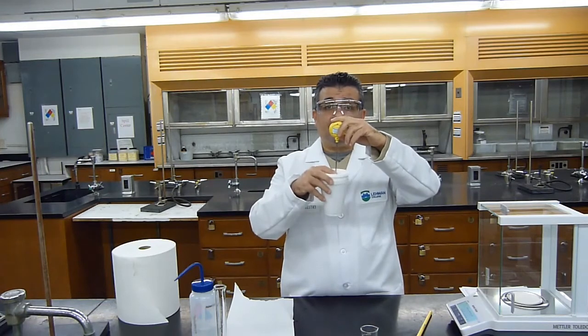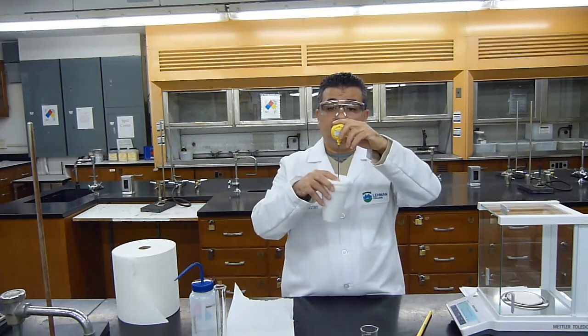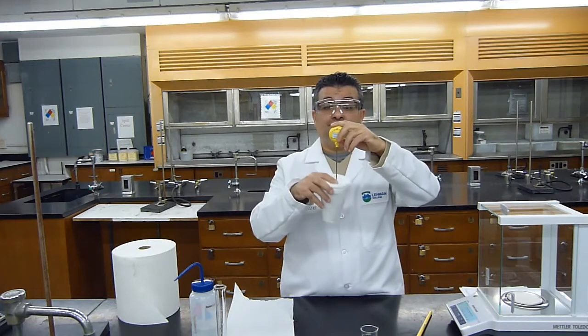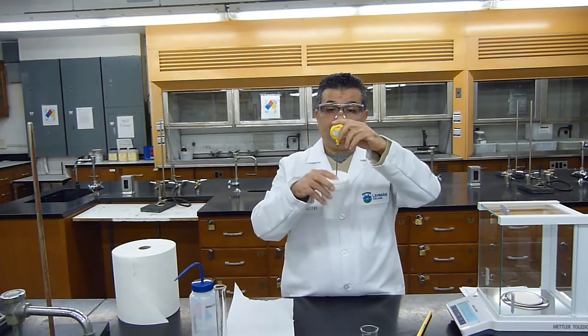I'm going to continue mixing and monitor the temperature. Now the temperature increased to 33.9 degrees. I will see if it reaches 34. Right now I'm at 33.9. Keep mixing, make sure all of the solid is dissolved.